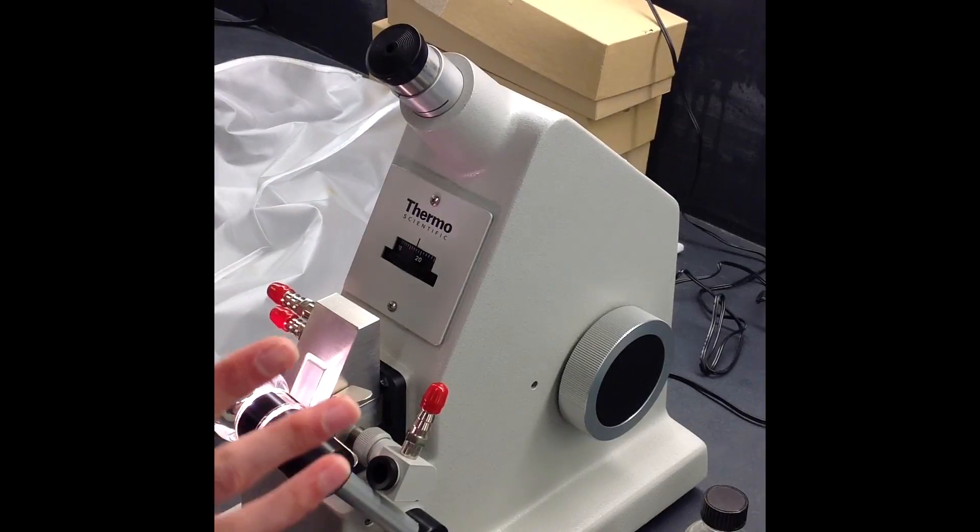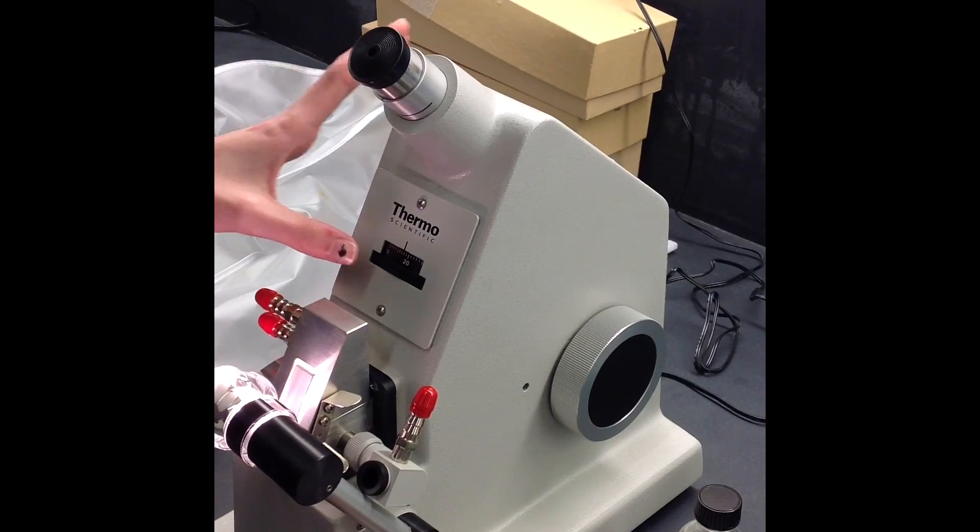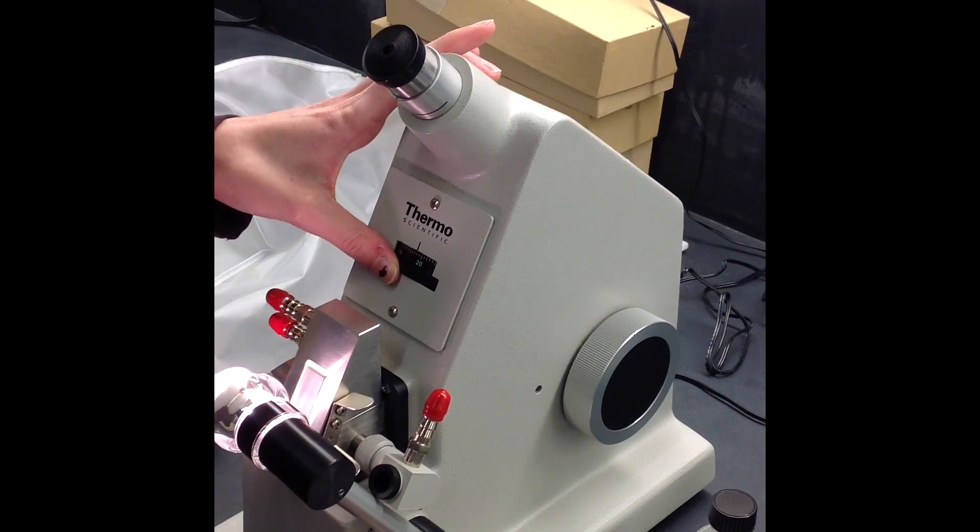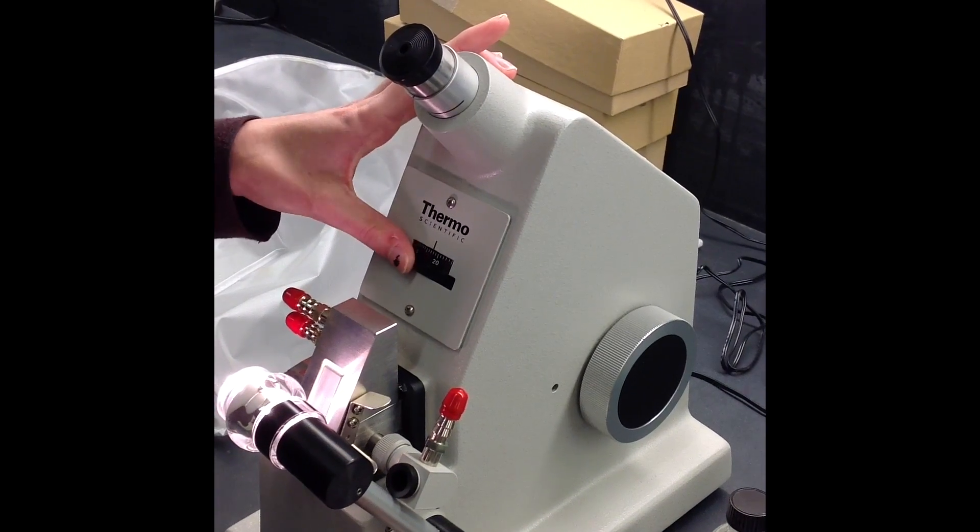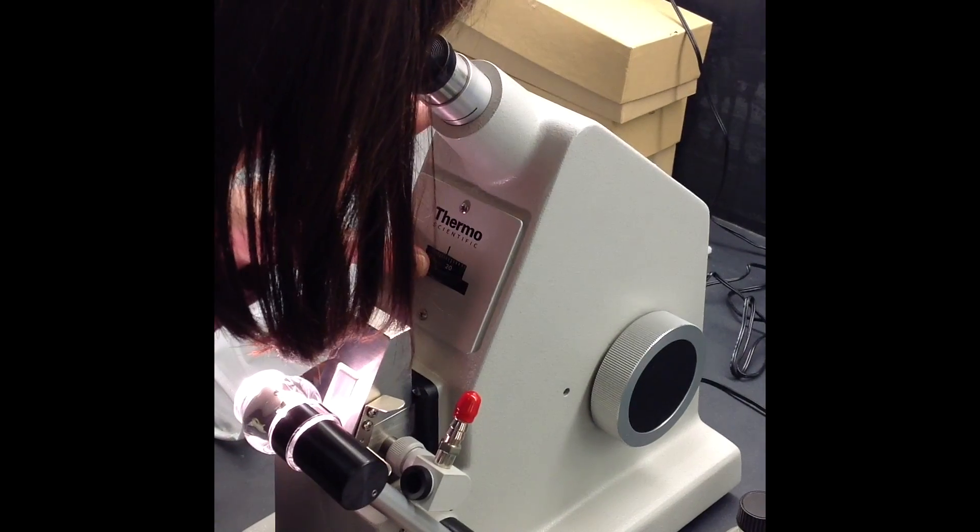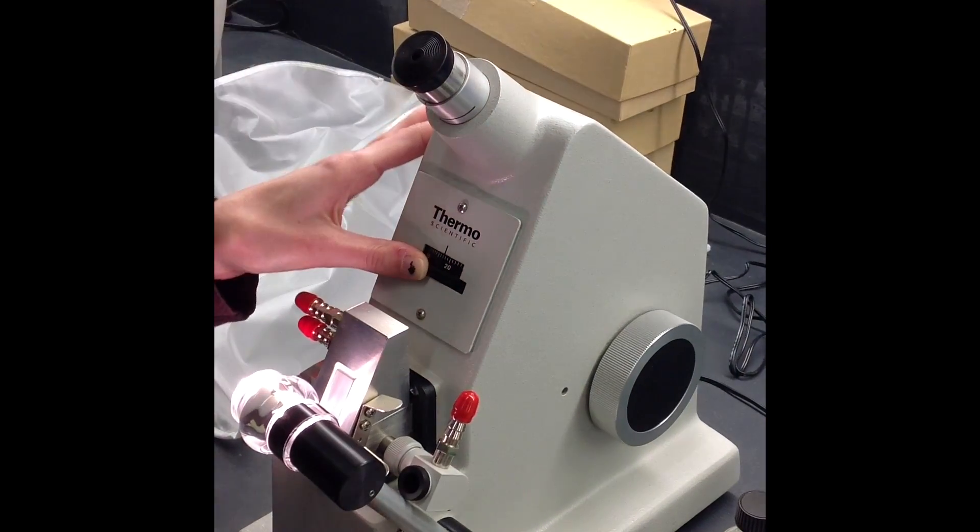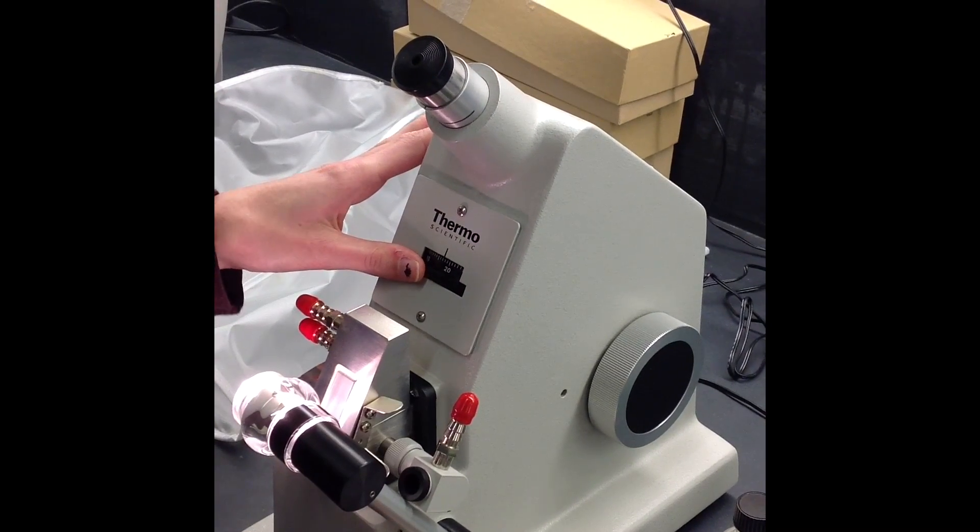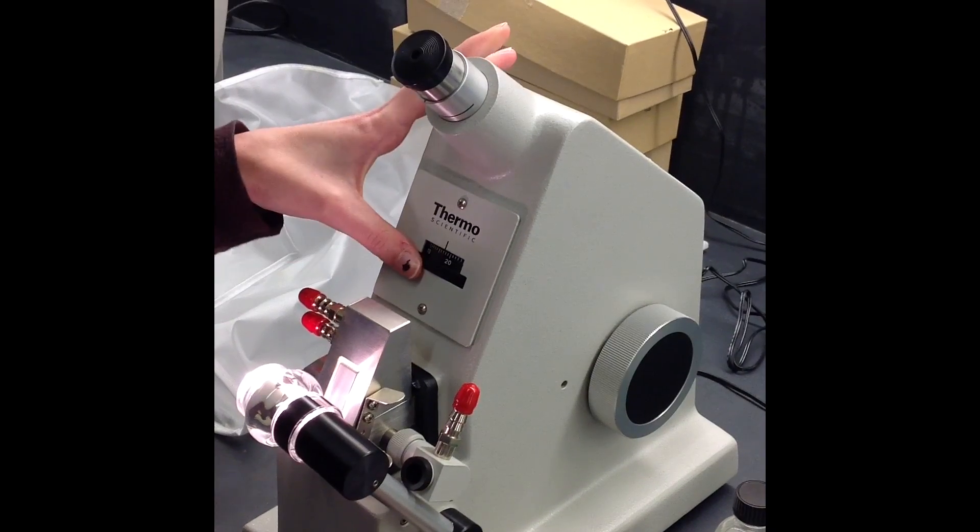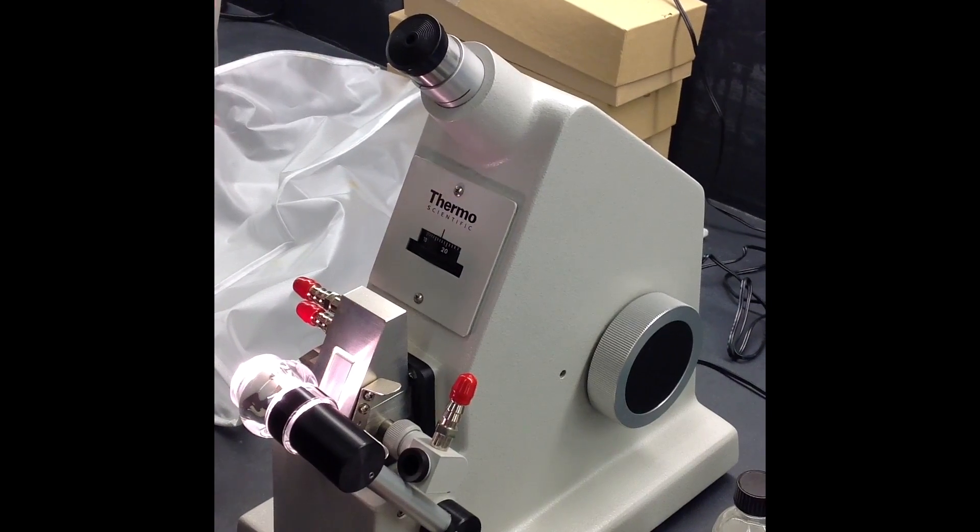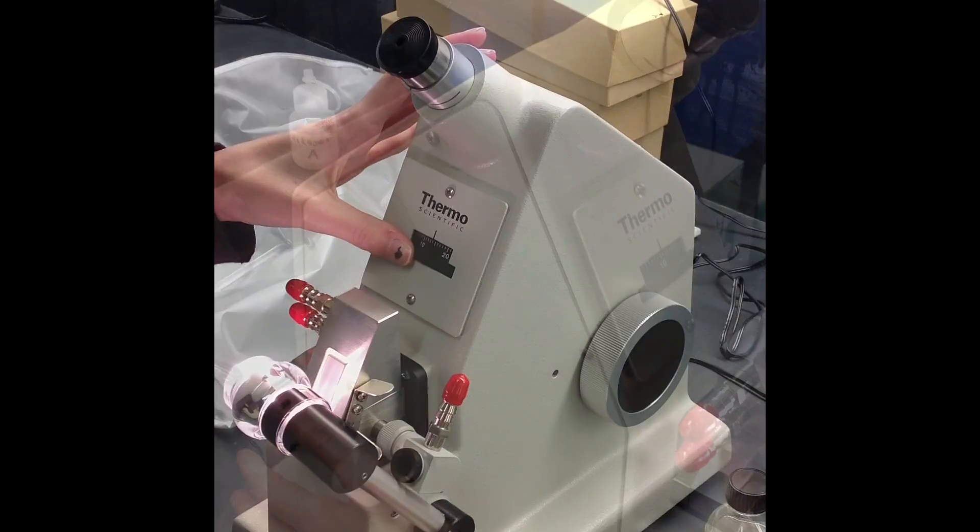Once the horizon is adjusted, we're going to do the crosshairs in monochromatic with this dial here. You might see two different colors - blue and red, yellow and black, or green - but they have to be two separate colors, and that's what this dial is for.